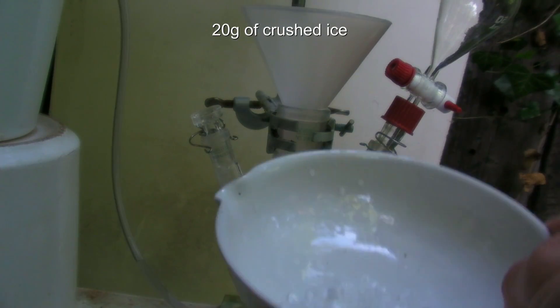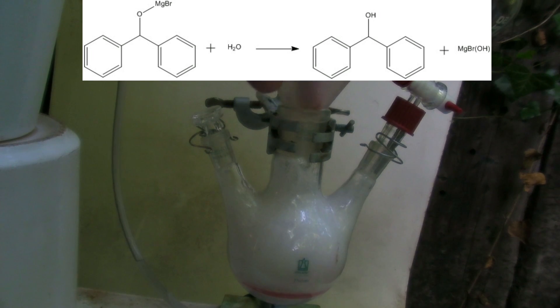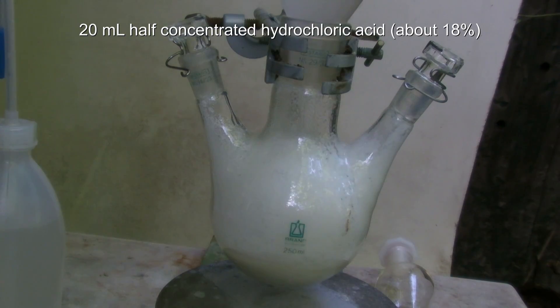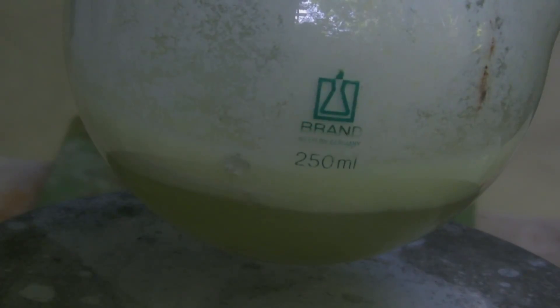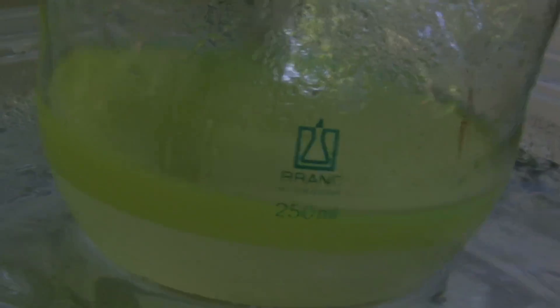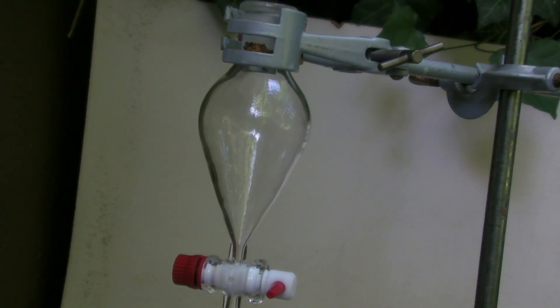After that, 20 grams of crushed ice are added to the cool mixture. This causes the compound to hydrolyze, forming benzhydrol and magnesium bromide hydroxide. Next, 20 ml of half-concentrated hydrochloric acid are added slowly. This causes the magnesium salts formed during the synthesis to dissolve. Note that the magnesium has not been consumed completely by the reaction. It is recommended to cool the flask with an ice bath, as otherwise the ether can begin to boil. At the end, the flask contains two layers: the upper organic layer, which contains most of the product, and the aqueous layer, which contains magnesium salts and a small part of the product.